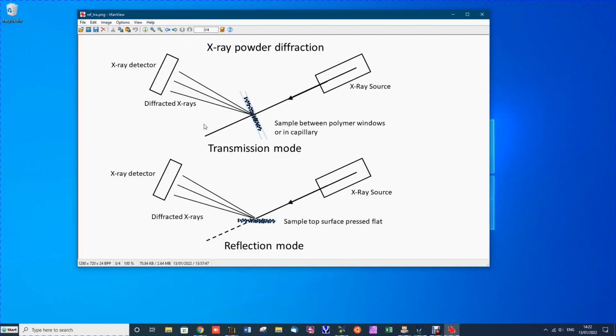software from Jeremy Sanders. Now in X-ray powder diffraction, transmission mode has the beam going through the sample, and then the diffracted X-rays are collected on the detector. The sample is held between polymer windows, and the beam goes through the whole sample, not just the surfaces of the sample. In the reflection mode, it's the surface of the sample that's giving rise to most of the diffracted pattern on the detector. And this is the reason why the sample top in the pressed flat sample holder will tend to have the crystals lying down, and reflections which are parallel to the B-axis are enhanced, and in this case the bar 402 dominates.